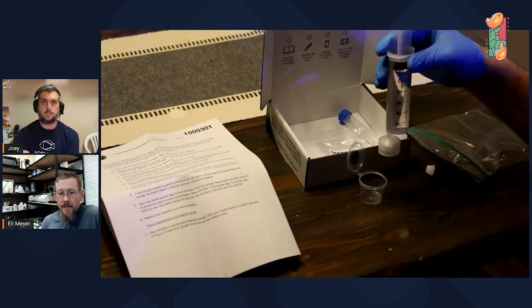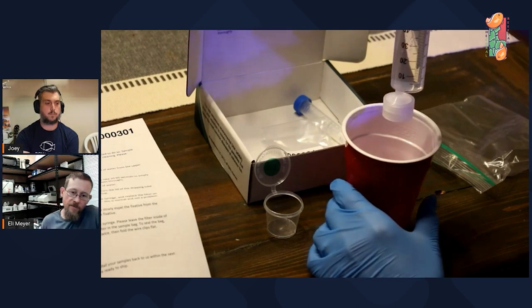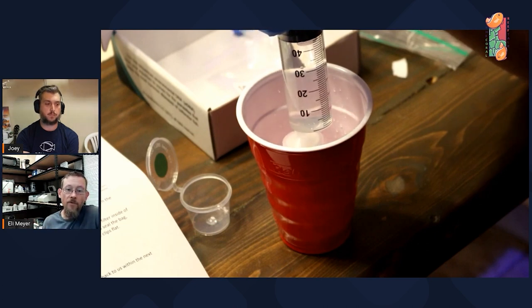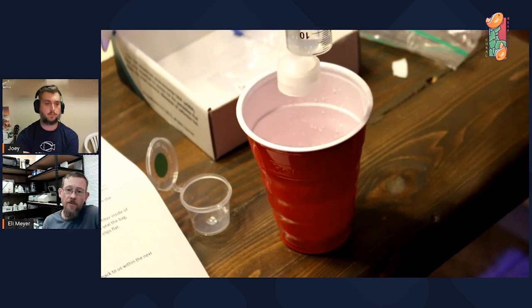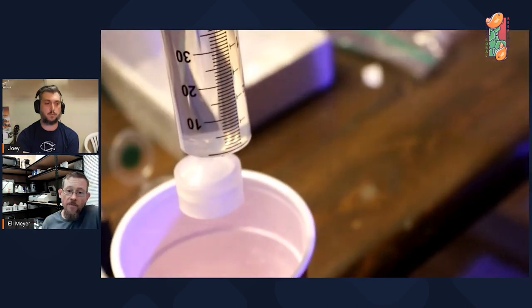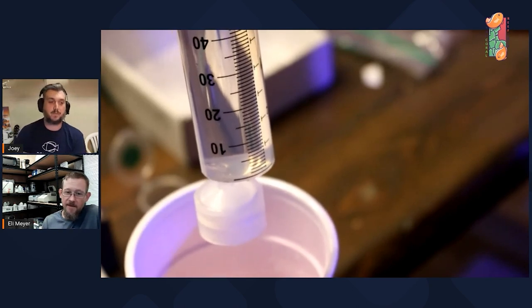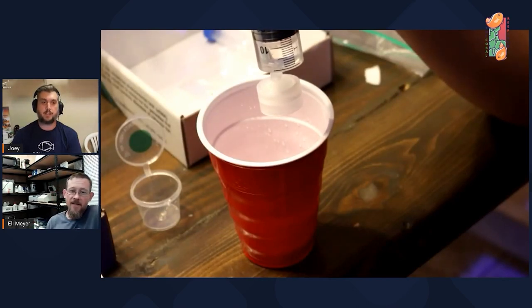There's a hidden difference in the filter used. For the microbiome test, your goal is to capture bacteria and archaea cells floating around in the water, pushing them down onto a filter. For the tank DNA test, it's actually a different filter — we're not capturing cells but rather the DNA floating around in the water, so we use a DNA binding filter with bigger holes to push more water through. The process is very similar for both: collect your water and push it slowly through the filter. Take your time — if you apply too much pressure, you'll blow out the seal and lose your sample.